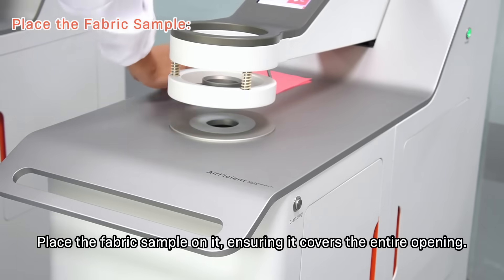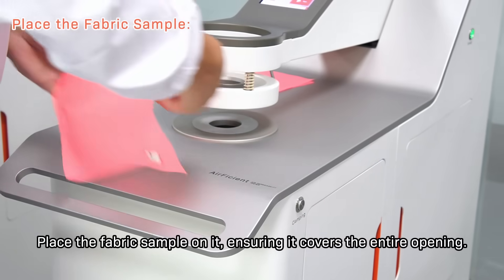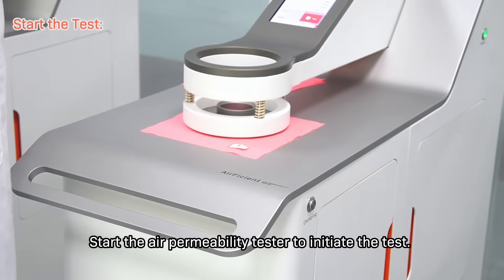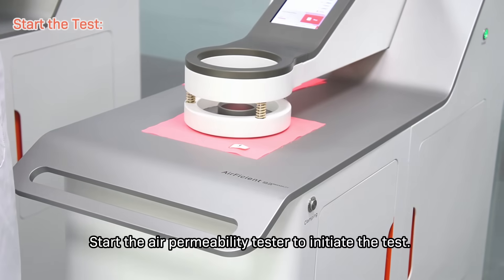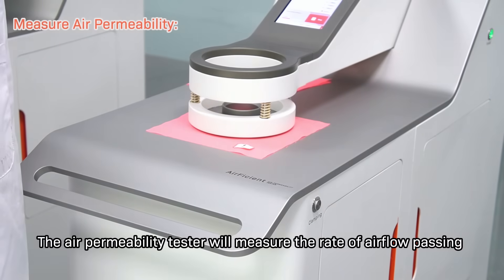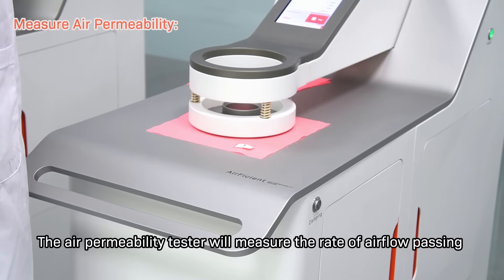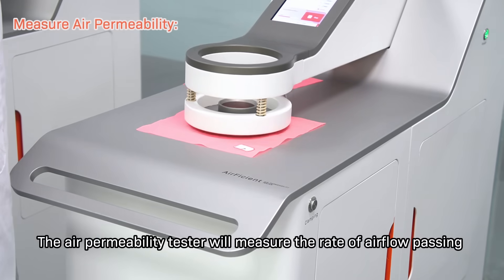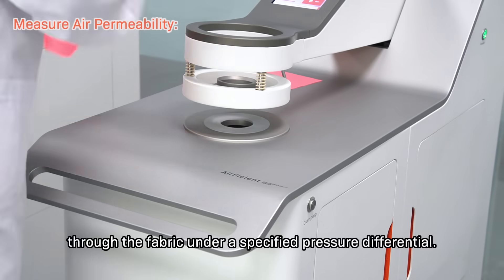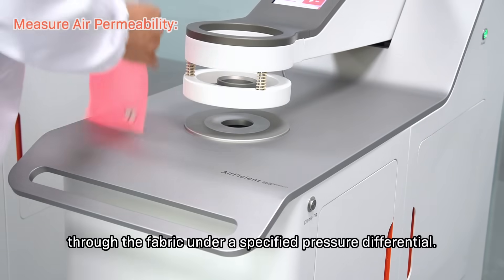Place the fabric sample on the tester, ensuring it covers the entire opening. Start the air permeability tester to initiate the test. The tester will measure the rate of airflow passing through the fabric under a specified pressure differential.